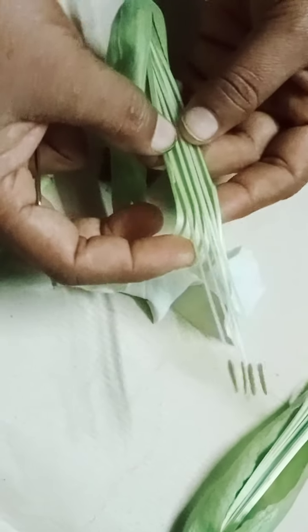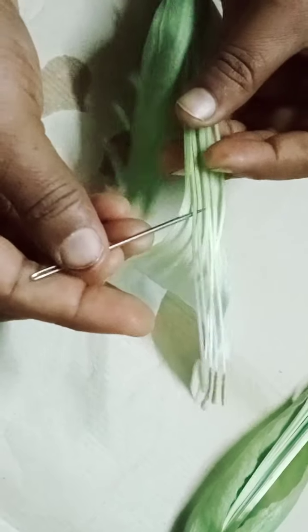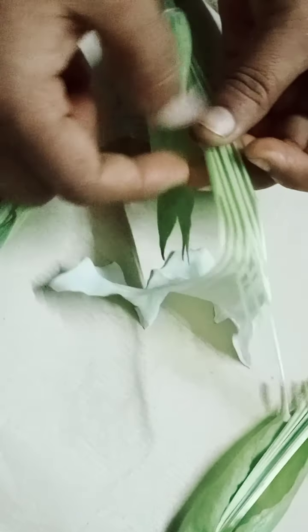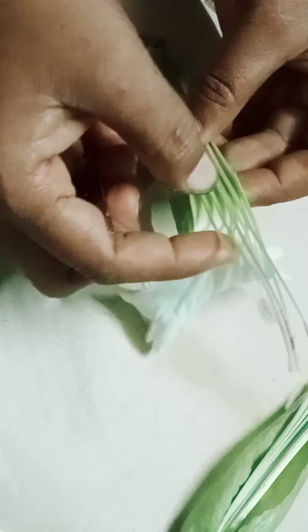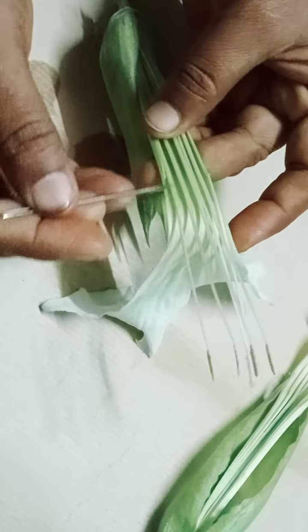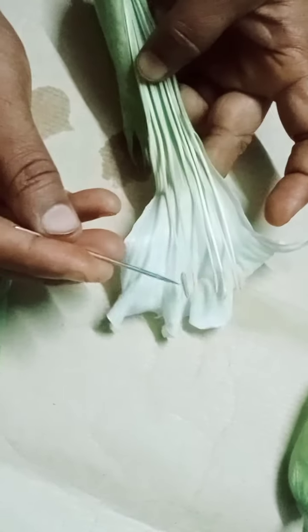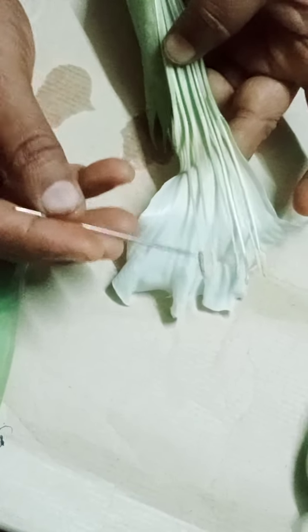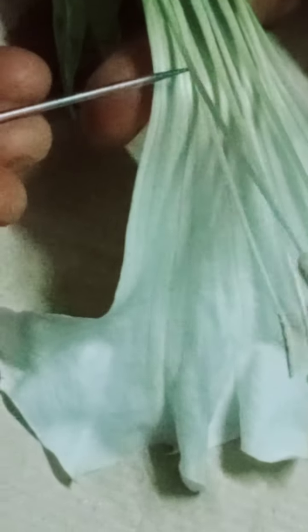This is the male reproductive part of the flower, which is known as the androecium. The androecium has two parts: one is the filament and the other is the anther. This is the anther part of the flower and this is the filament part of the flower.